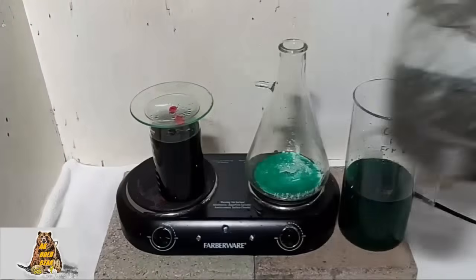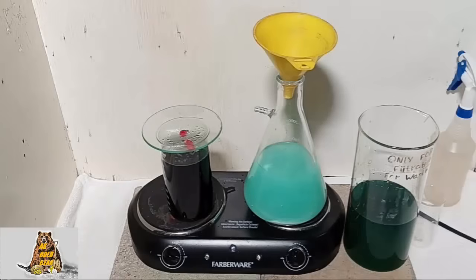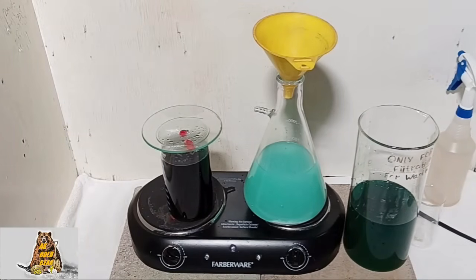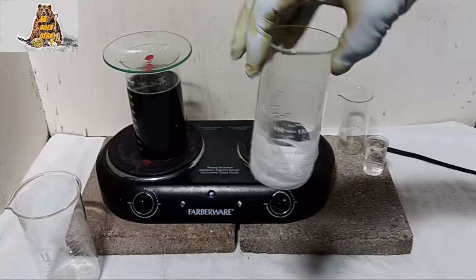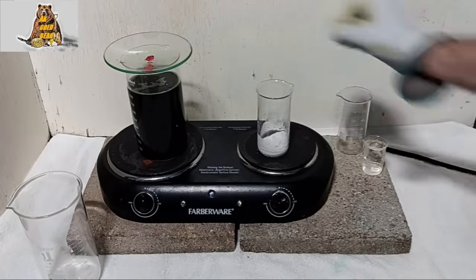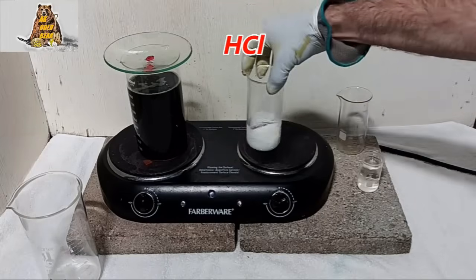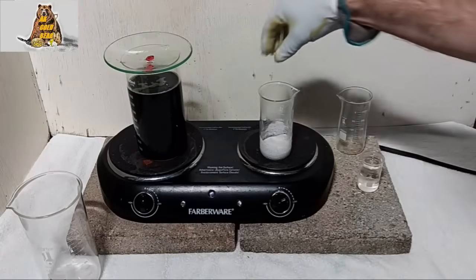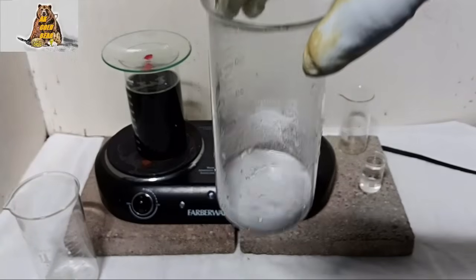Hot water. I need to wash my silver chloride 3 to 4 times in hot water. I washed the silver chloride in hot water — now my silver chloride is clean. Now I need to convert silver chloride into metallic silver. For that I need a little hydrochloric acid and pure zinc. Hydrochloric acid, pure zinc, and nothing else.